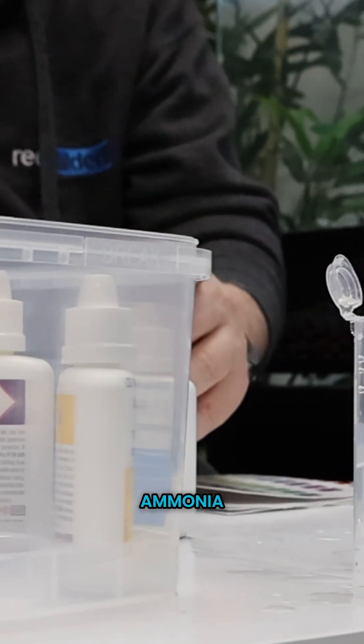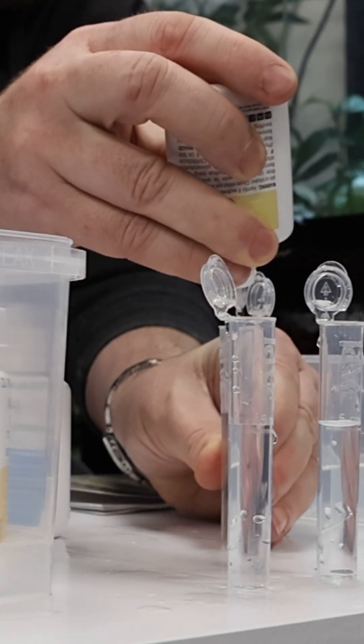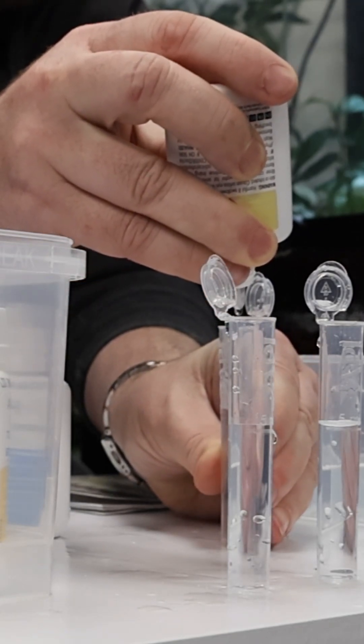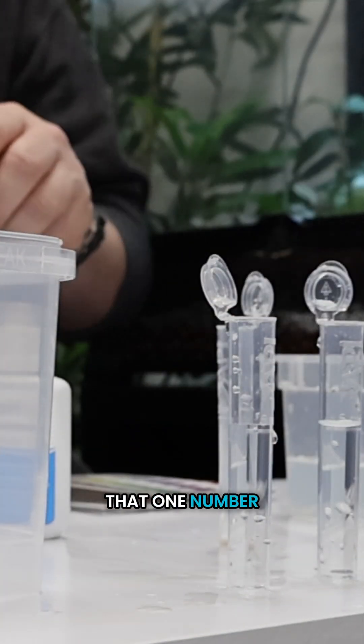So I'm going to test for ammonia. Two bottles, eight drops each. Back on that one, number two.